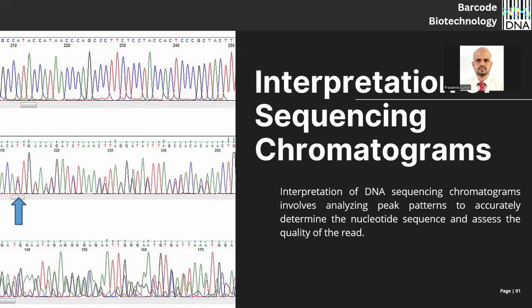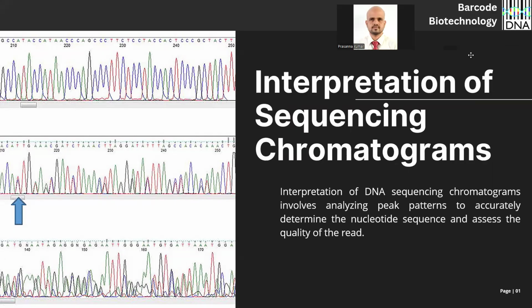So today we are getting into a much more technical part called interpretation of sequencing chromatograms. How are we going to interpret the sequencing chromatograms? Before we start, I want you to know how it looks. The DNA sequencing chromatograms involve analyzing them. They are actually a machine output file, the default machine output file generated by ABI sequencers.